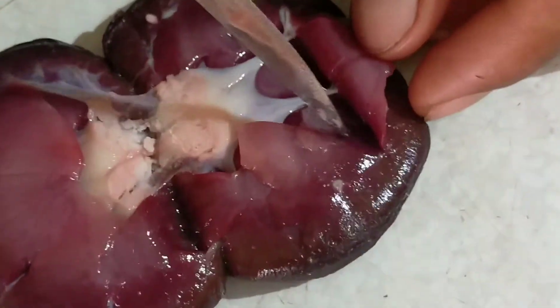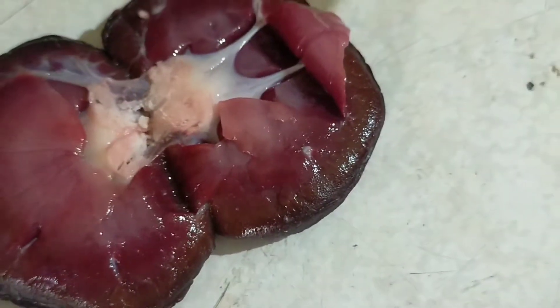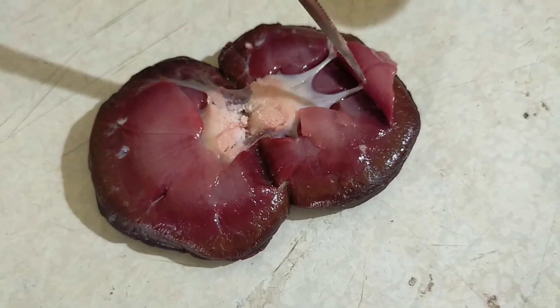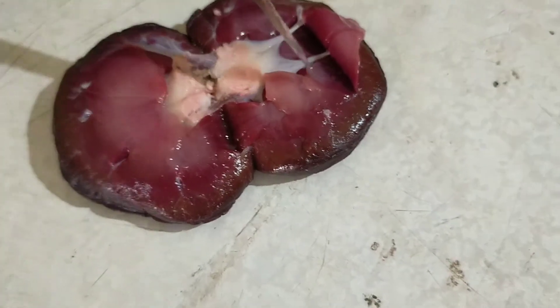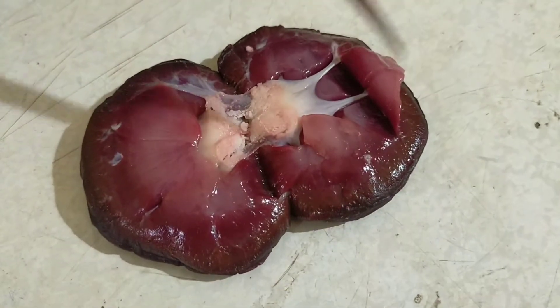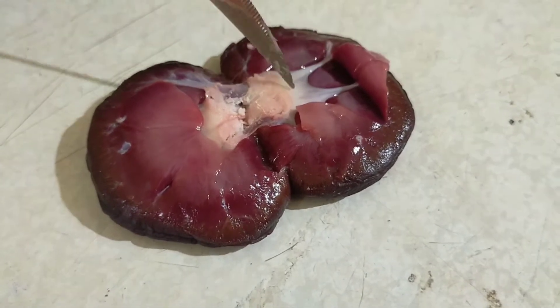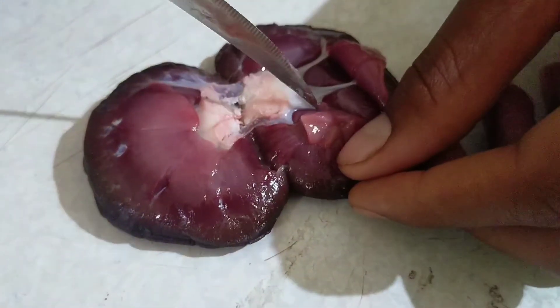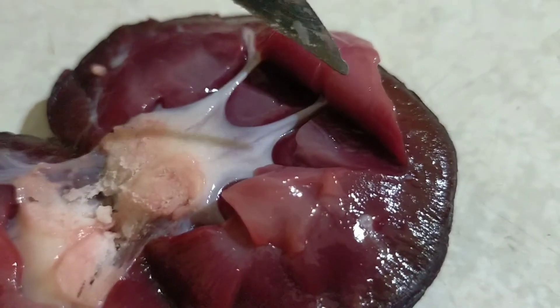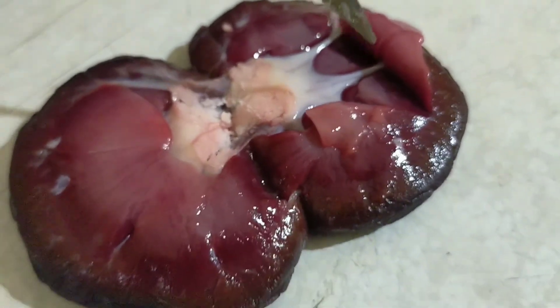Here this small micro-like structure is the nephron. The nephron is the most important organ in the kidney. The main function of the nephron is filtration of urine. The mechanism of formation of urine occurs in the nephron. And this structure is known as pelvis. Here we have the small microscopic nephrons. There are millions of nephrons present in the kidney. These nephrons are the functional unit of the kidney.